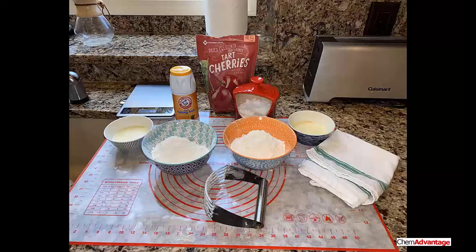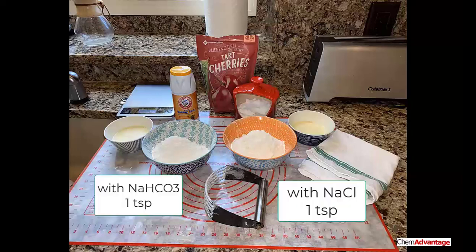I mentioned before that the baking soda is used for baking because it produces carbon dioxide to provide a little bit of fluff for pastries and baked goods. So I decided to experiment with a little bit of baking soda and a substitute for the baking soda, salt.